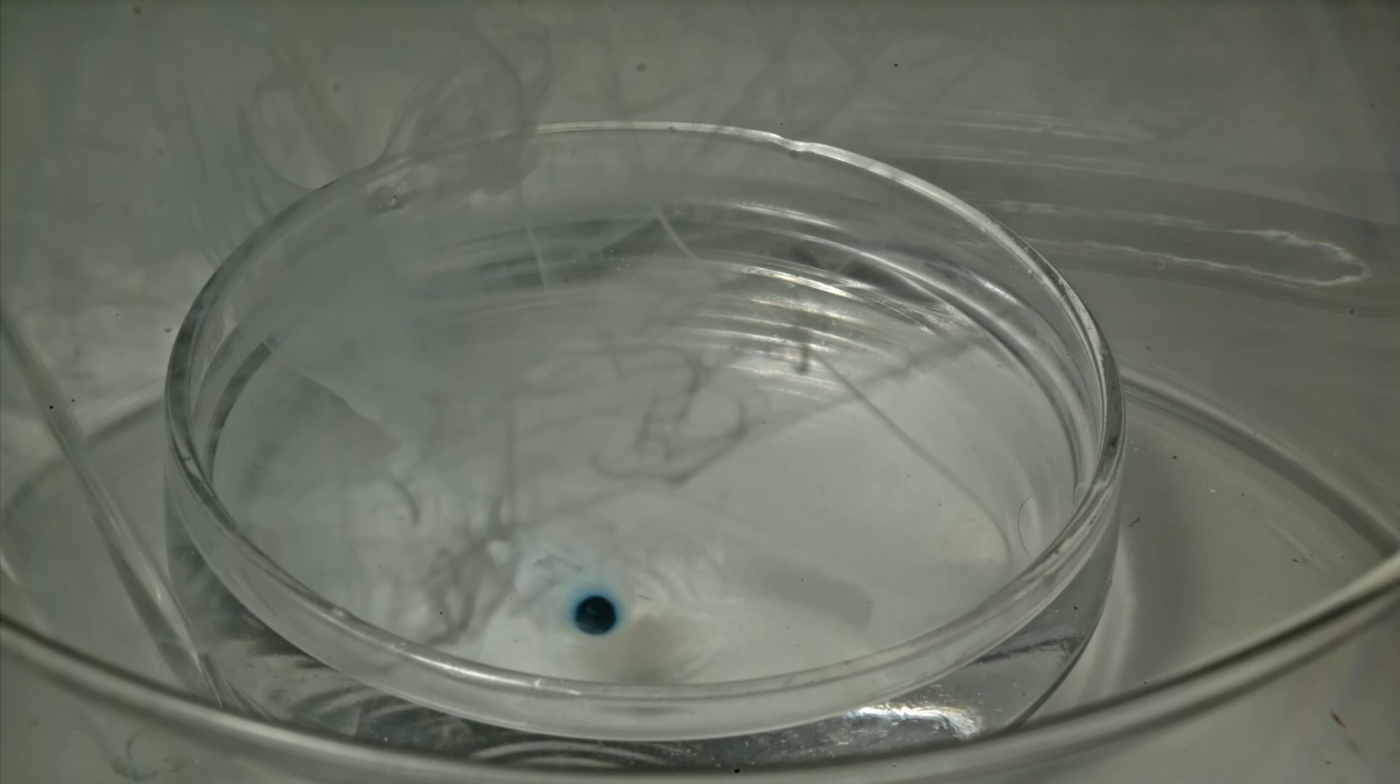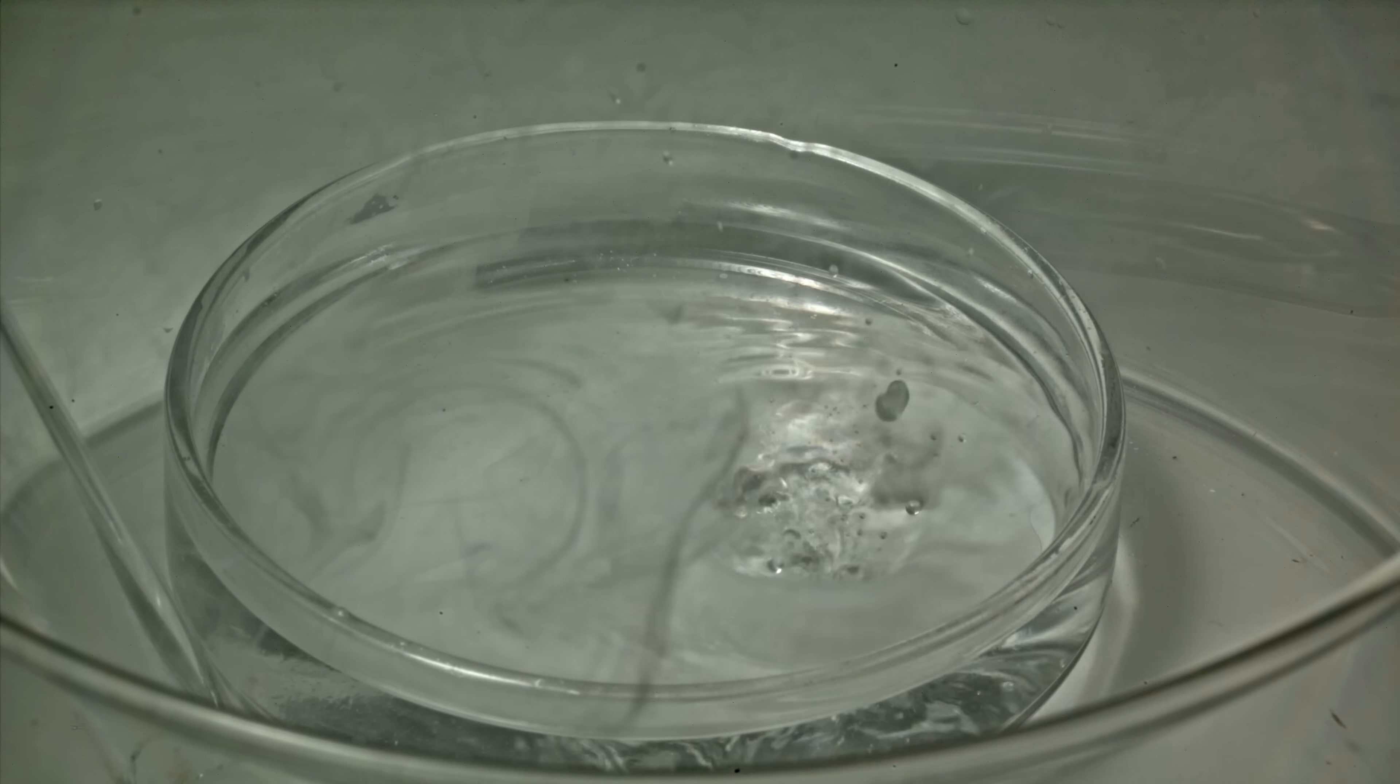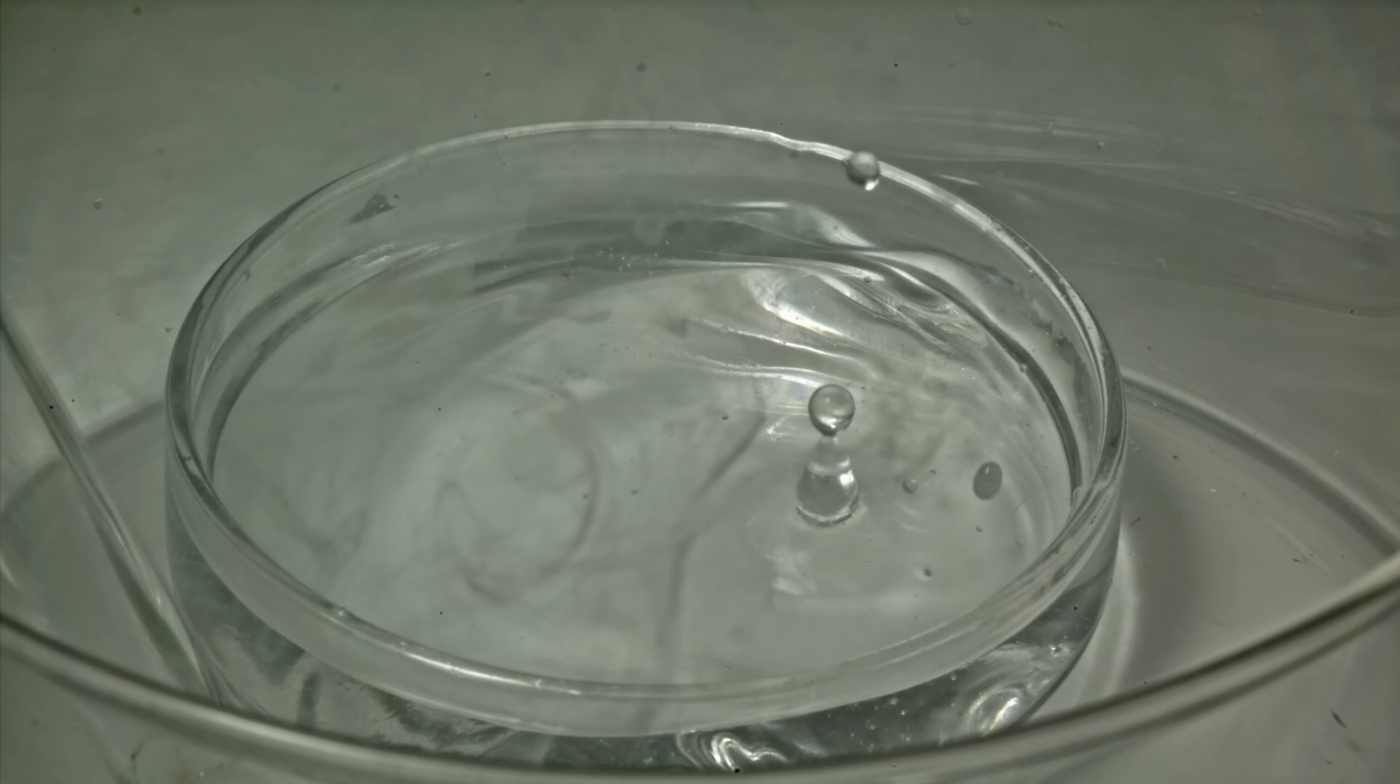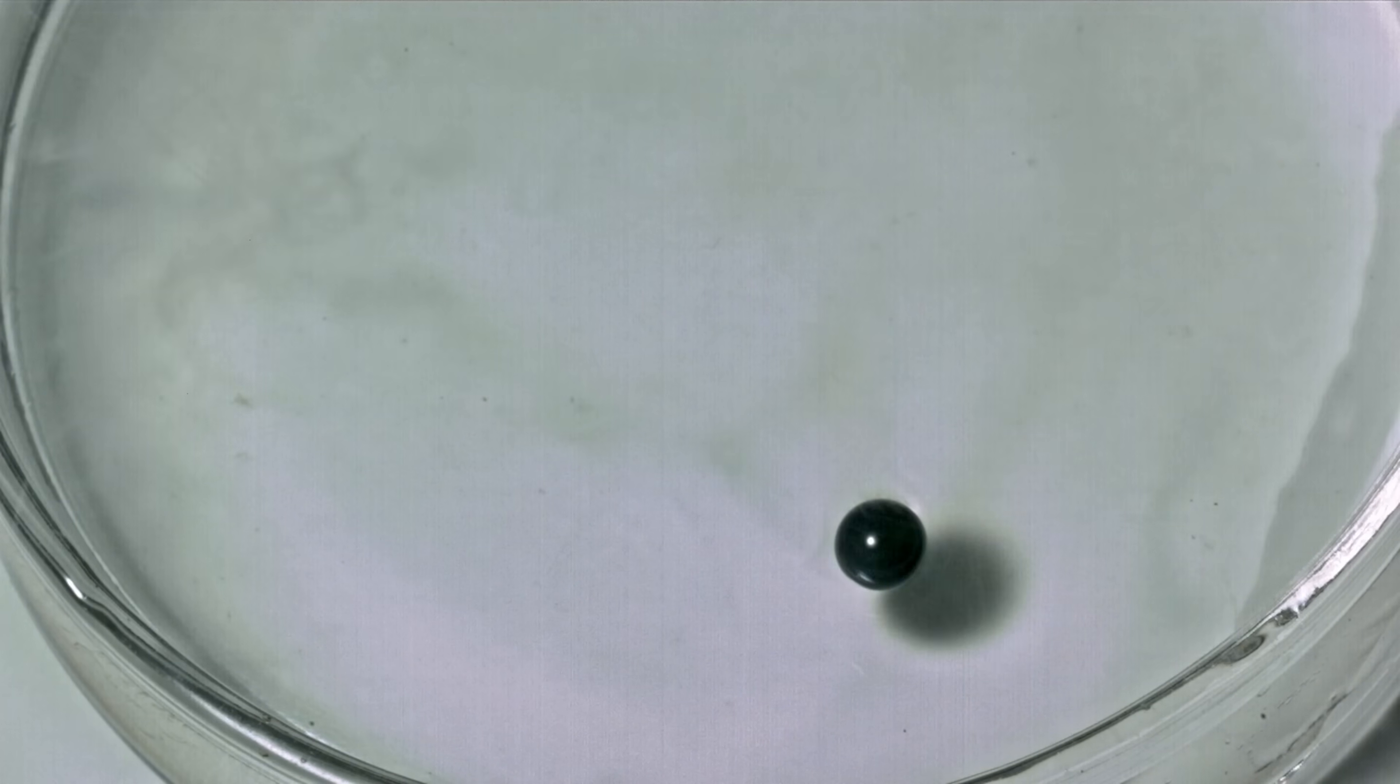Eventually, this drop will lose its color and explode. I was able to record this process in slow motion. After the reaction, a transparent drop of molten hydroxide temporarily stabilizes on the water's surface via the Leidenfrost effect, before bursting spectacularly once it cools sufficiently.